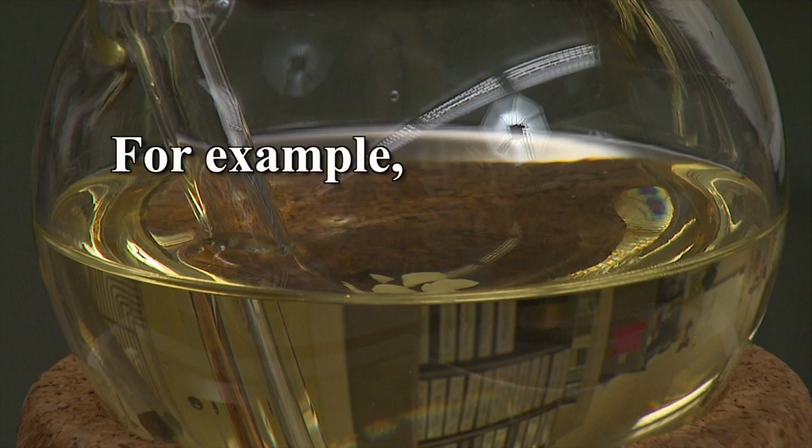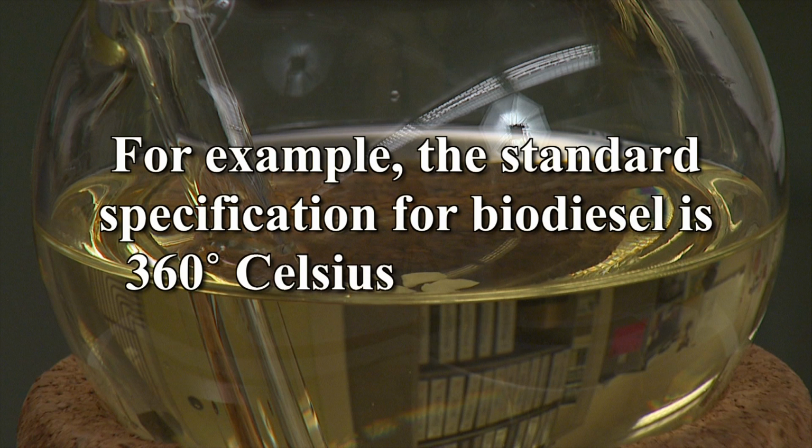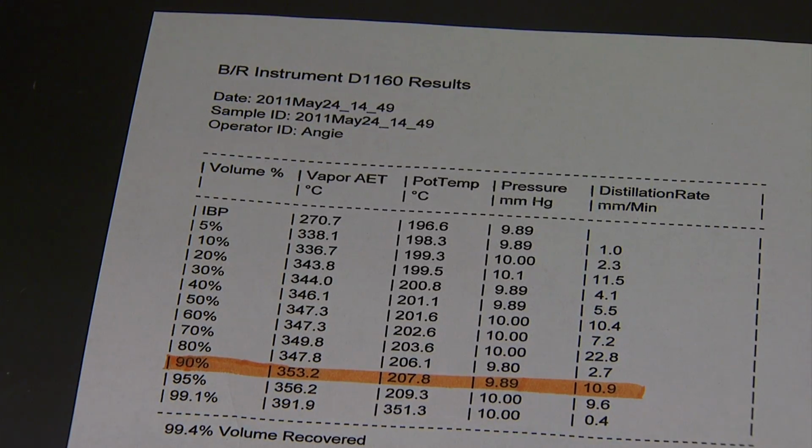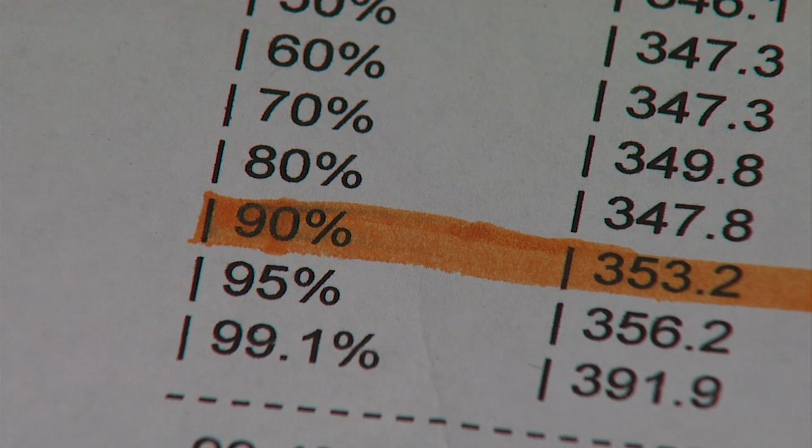For example, the standard specification for biodiesel is 360 degrees Celsius max at T90. That means when 90% of the sample has been distilled or collected by the receiver flask, the vapor atmospheric equivalent temperature must be less than or equal to 360 degrees Celsius.